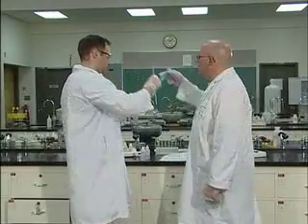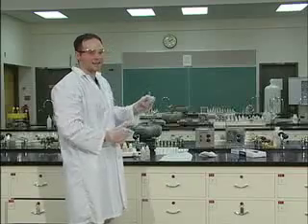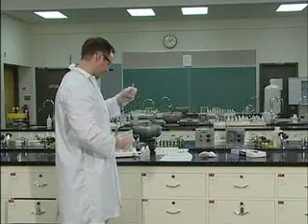Thank you, Jeff. It seems like I'm cleaning this thermometer all the time. I know. You might want to ask your lab partner if they can do that for you.